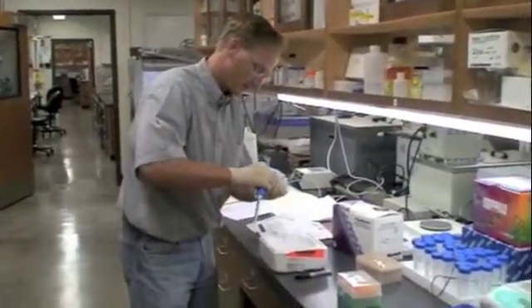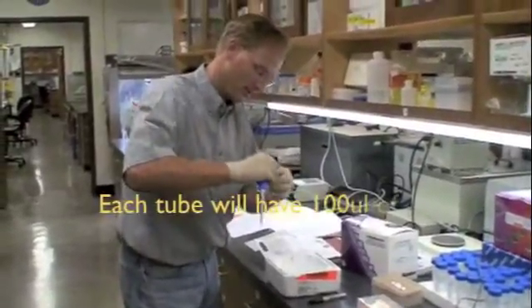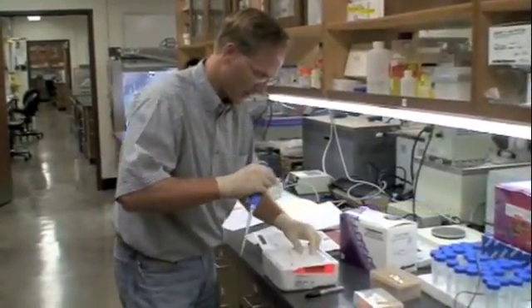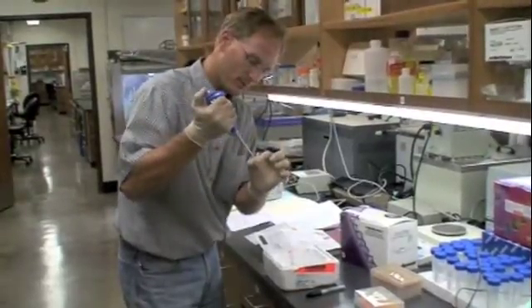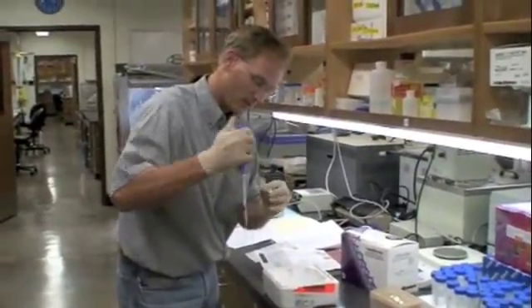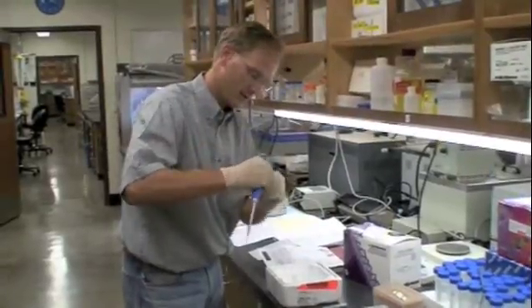Take 50 microliters — gently flick the tube. I take 50 microliters out because I don't need to use the whole tube. There's more than one transformation in there. I'm putting it into a pre-chilled tube. There's the 50 microliters. And then I need a tube for my control as well, so I'm pulling out another 50 microliters and sticking it here.